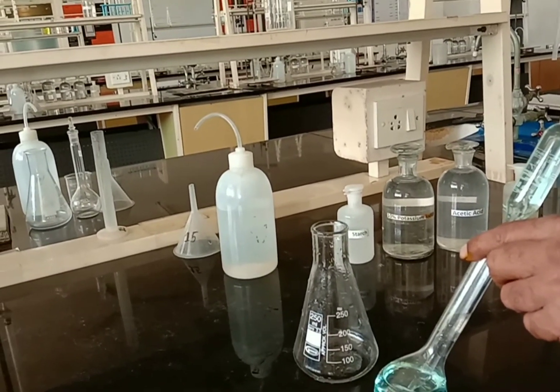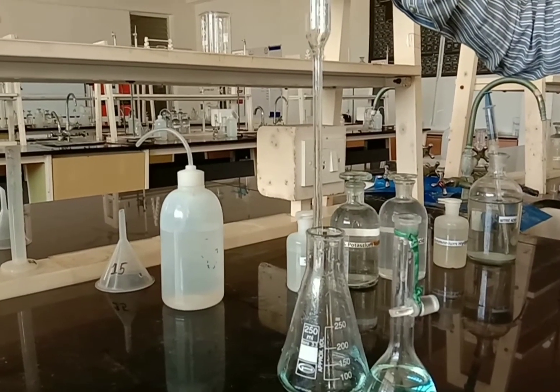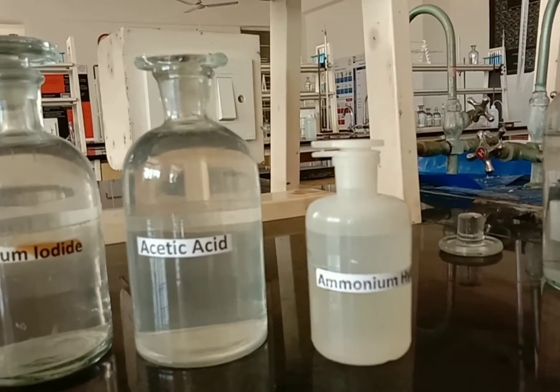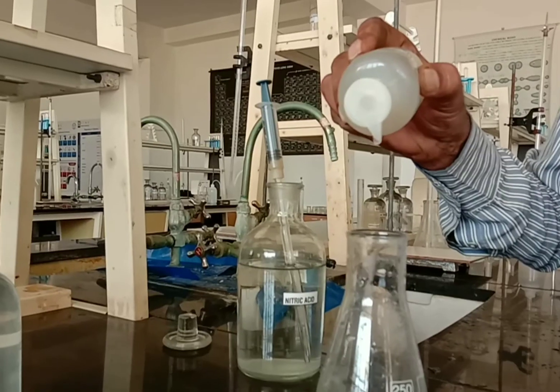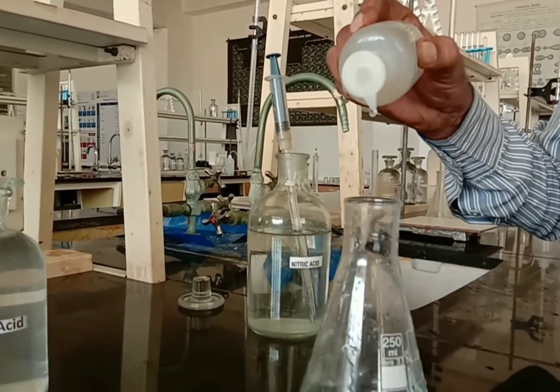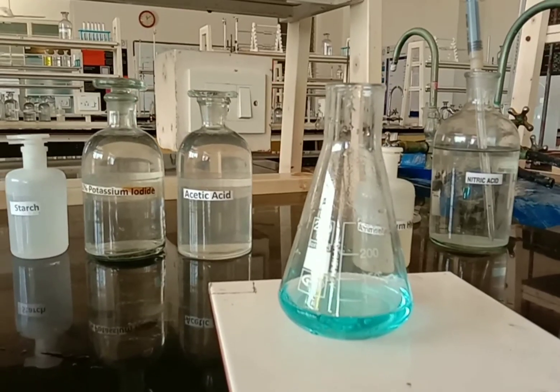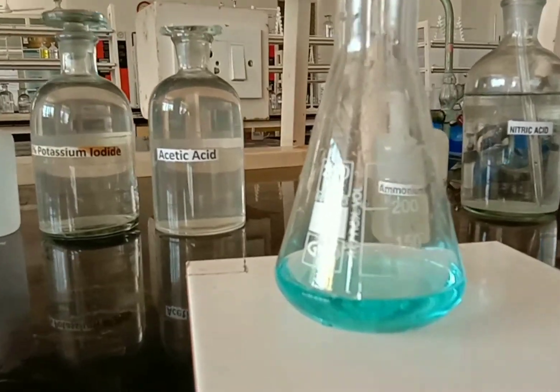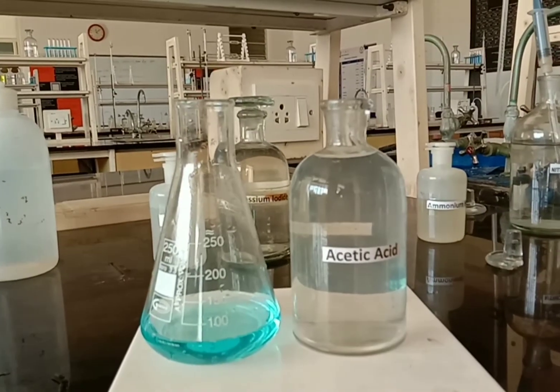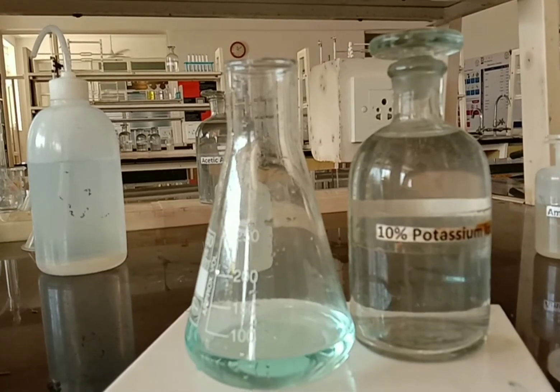Pipette out 25 cm³ of the standard brass solution. Add ammonium hydroxide dropwise to neutralize the mineral acid until the solution shows a slight blue precipitate.